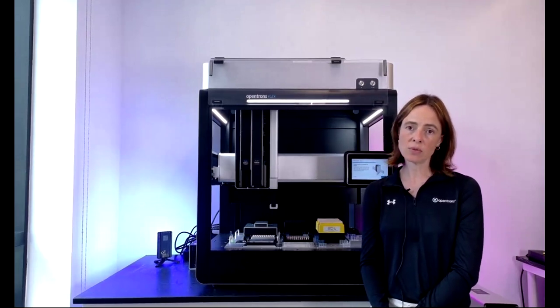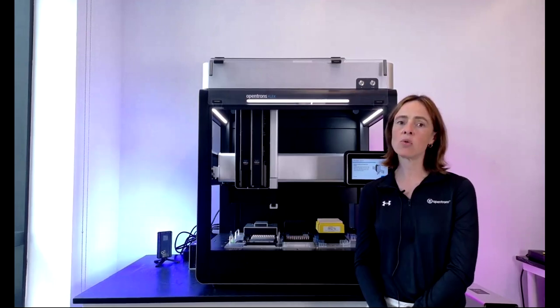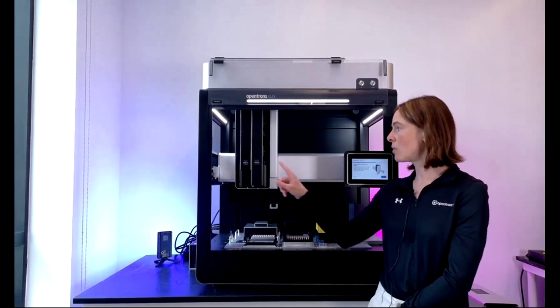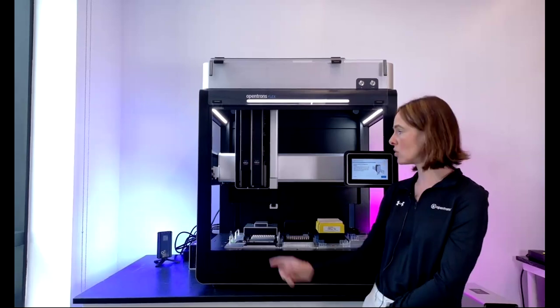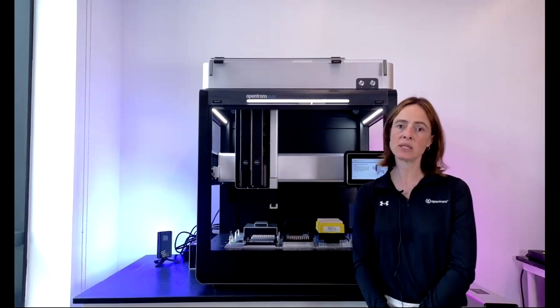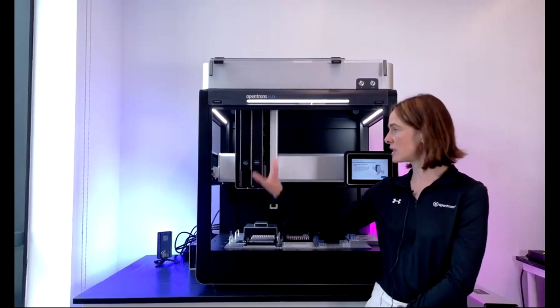So in that regard, you can really use the 96 to provide a whole bunch of different ways to pipette things around the deck. One thing to note is you can hold any combination of single and 8s on the gantry. So you can have 2 singles, 2 multis, or as we have here, a single and a multi next to each other. Or you can have the 96 channel on its own just because it takes up sort of the whole space here.